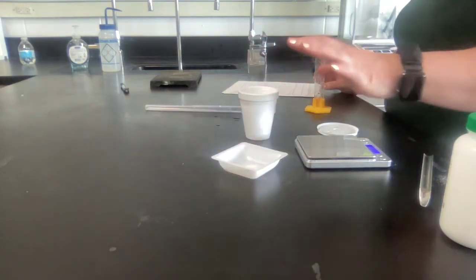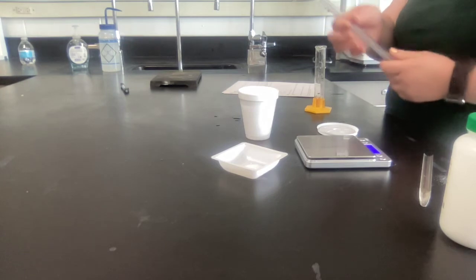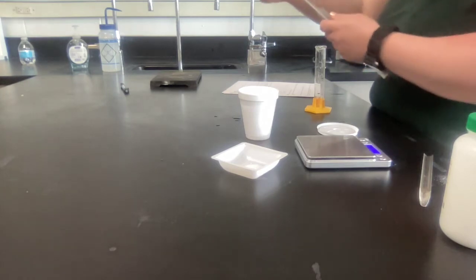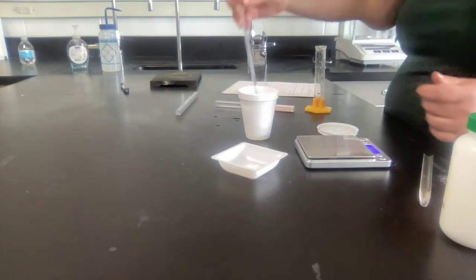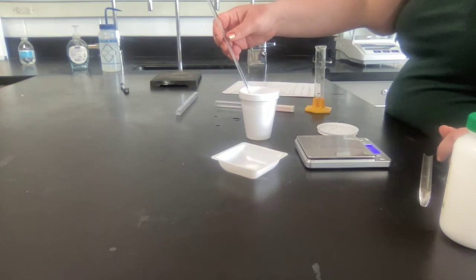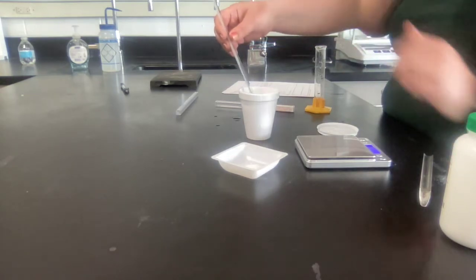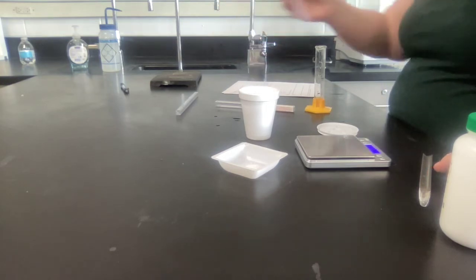Don't pour that in yet. You're going to take your thermometer. Your thermometer is likely in a case. Make sure you take the thermometer out of the case. Then you're going to put it in the water. Wait for it to stabilize and take the initial temperature of the water. This thermometer is in Celsius, so write down the initial temperature of the water.